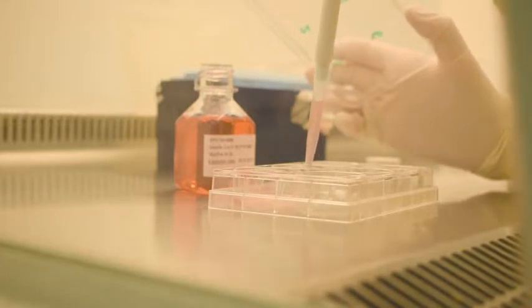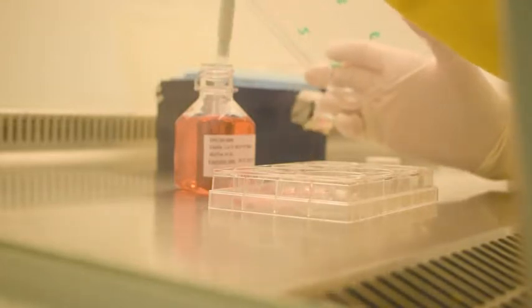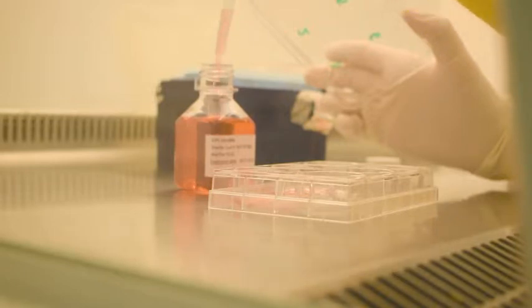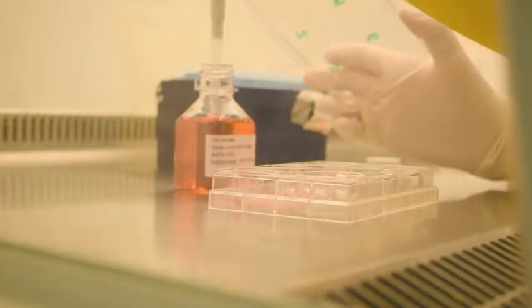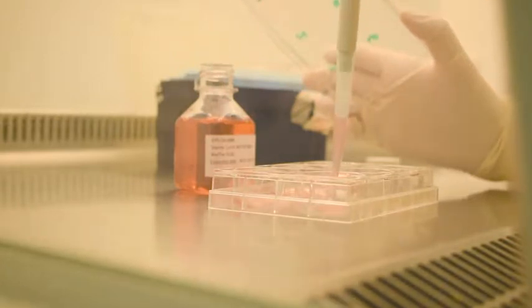900 microlitres of warm sterile new maintenance medium included in the kit is added to each well of a 6-well plate. For a batch of 24 models, 4 6-well plates are required for 1 well per model.